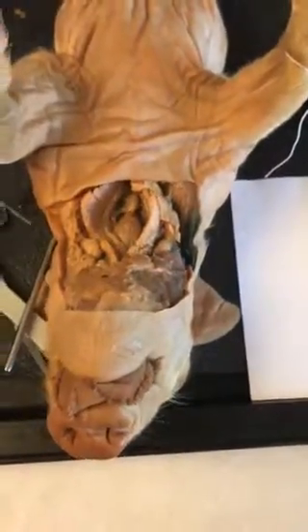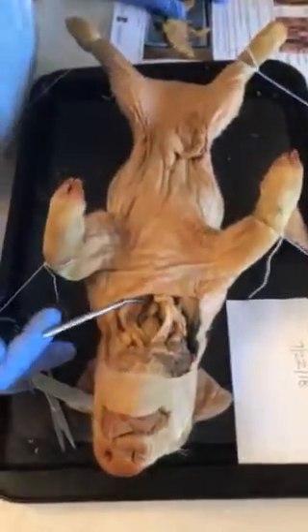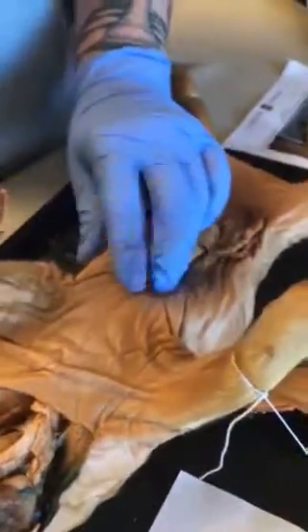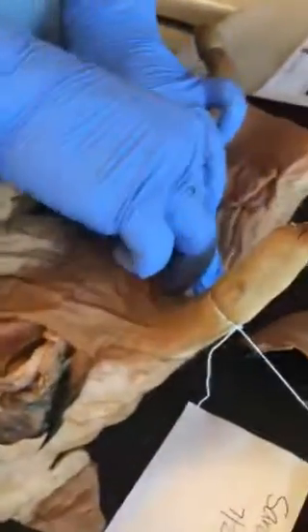Okay, we will digitally label the thymus and the thyroid. If you cannot identify the structures, explain why. In the next step, you will dissect the thoracic cavity to view the underlying organs and blood vessels. First, palpate the lower chest to find the inferior region of the rib cage. This is the inferior region of the rib cage here.